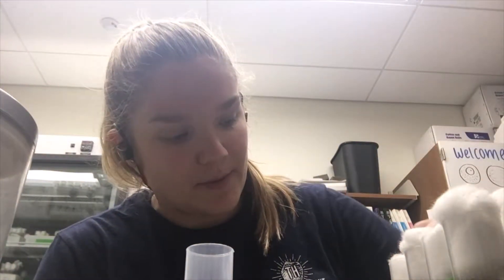So that's what I'm gonna do for all of these vials of flies — flip them all, make sure they're all ready to go and none of them are moldy or dead. I'll time-lapse that so you don't have to watch me do this forever. See you guys in a second when I show you the rest of my lab.